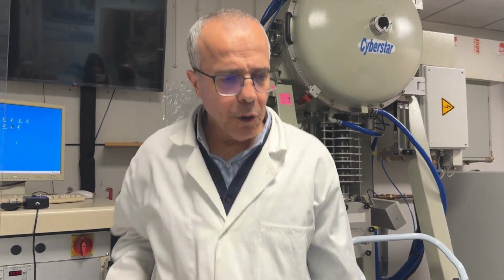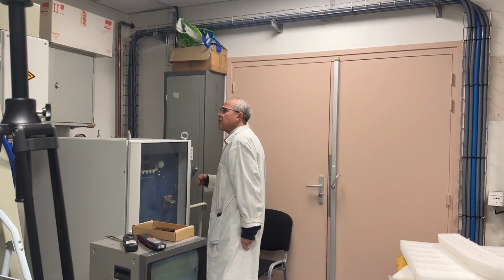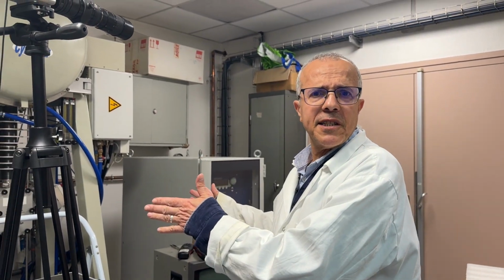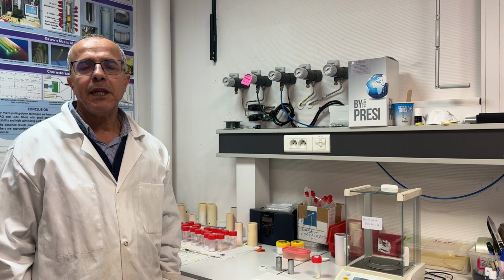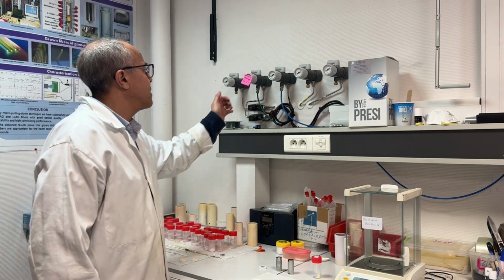I have a register, I have a tool to read the pressure inside. I will wait until the pressure is 10^-1. After that, when the pressure is 10^-1, I start to put gas inside. Now we reach vacuum 10^-1 millibar, so I will start to put gas inside the machine.